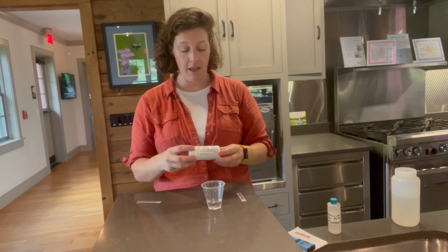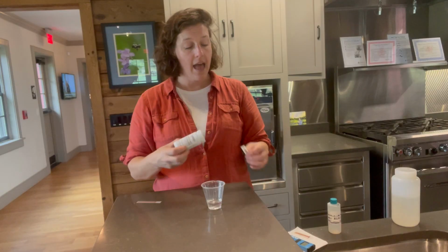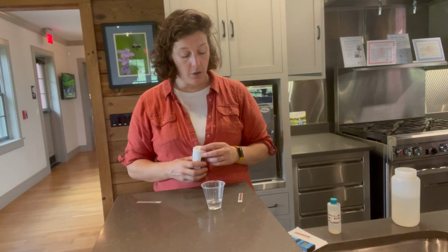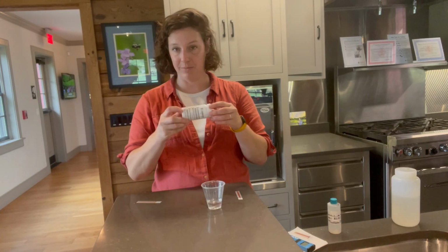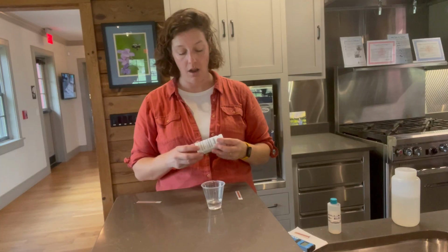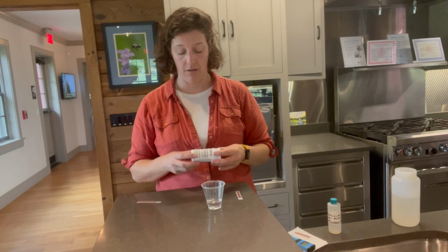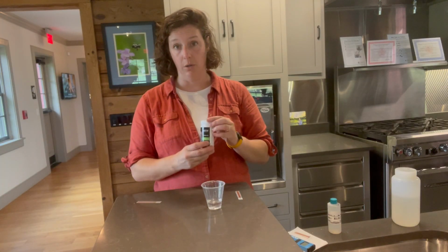On the other side of the coin, if you get a reading that is above the edge of the conversion table, this lot number ends at 8. However, my test strip goes all the way up to 10. You'll run into a similar problem. How do you report that? On your data sheet, you can note what your actual Quantab unit number was, say 1.2, but my test strip doesn't start until 1.4 on the conversion table. You would note that it was 1.2 and you're unable to determine the percent sodium chloride or the chloride parts per million. You can write non-detect, or you can put in your notes section that it was less than the readable limit. Similarly, the same kind of reporting applies if it was over the readable limit for your chloride strip.